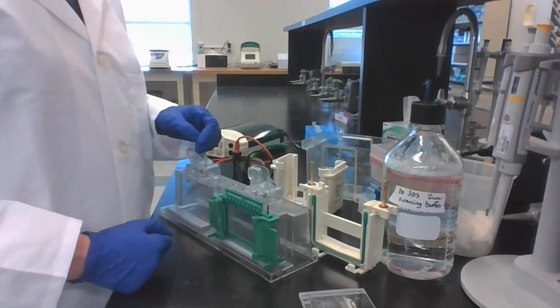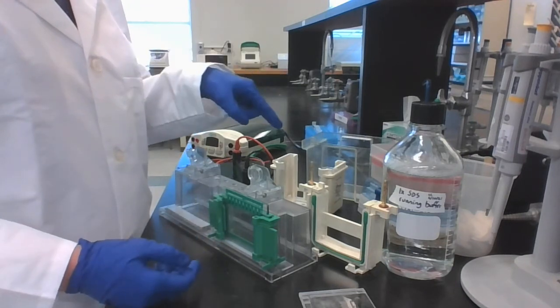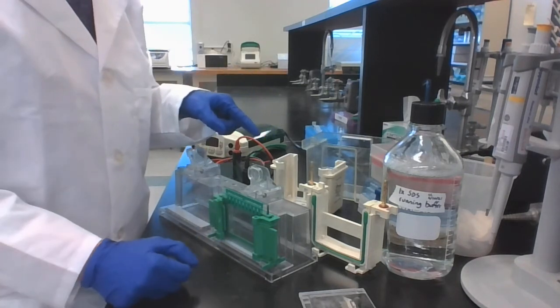In this video, we're going to take our polymerized gel and put it in the gel tank, and then load it with samples and run it.